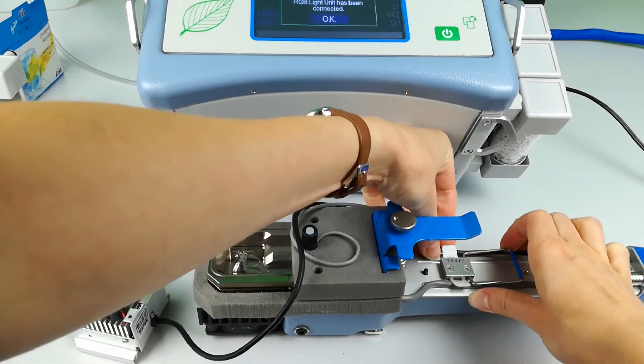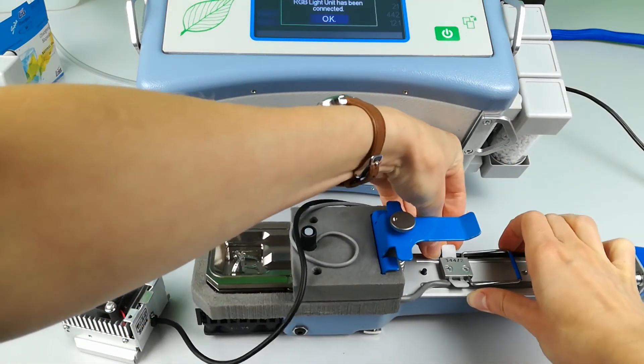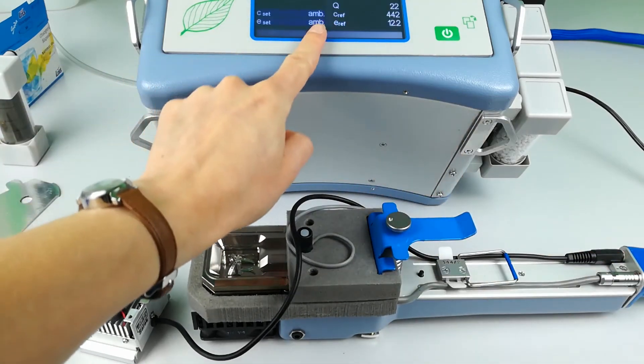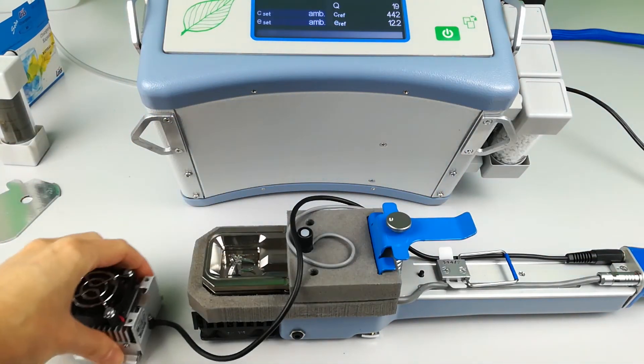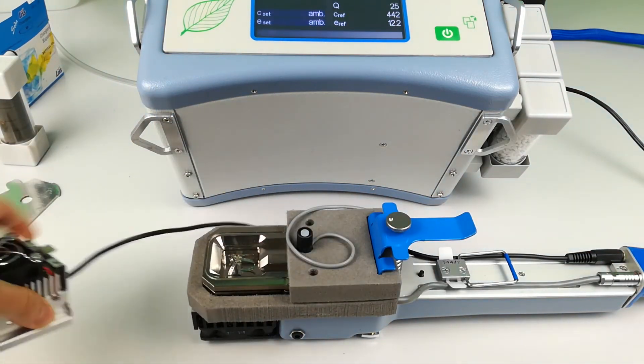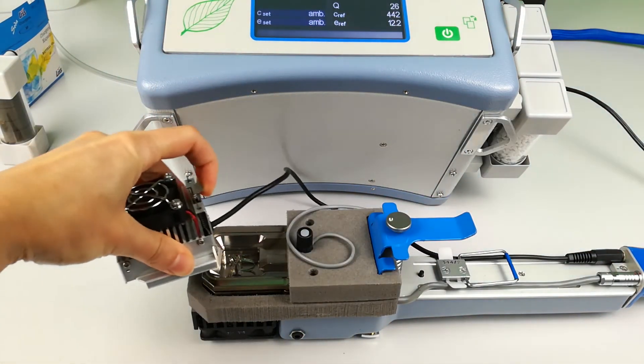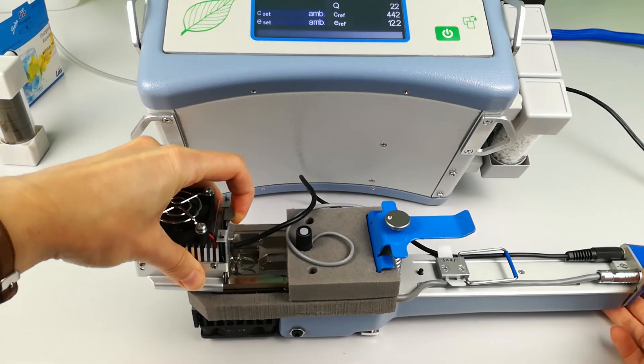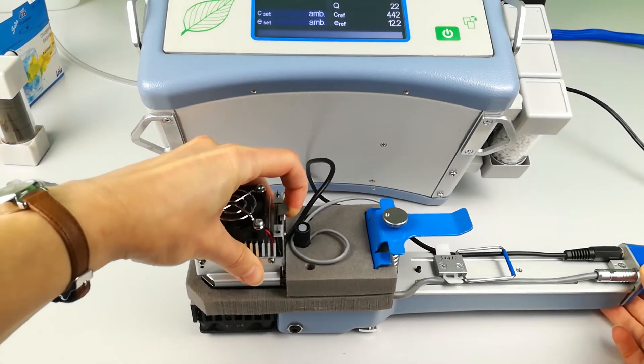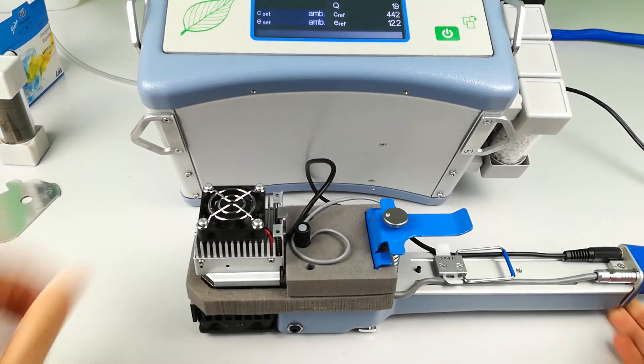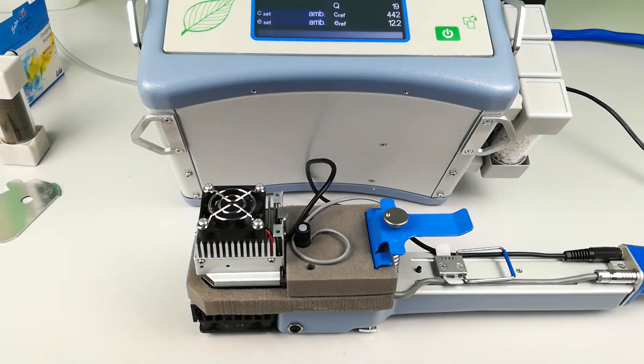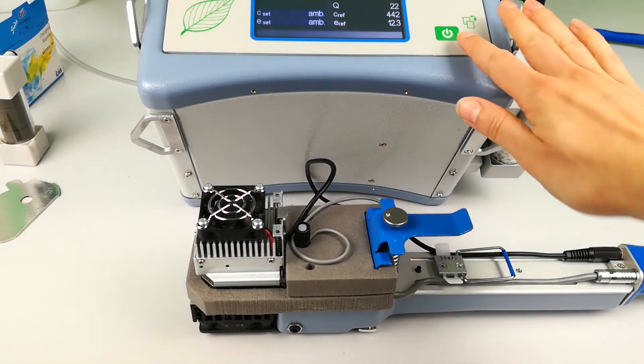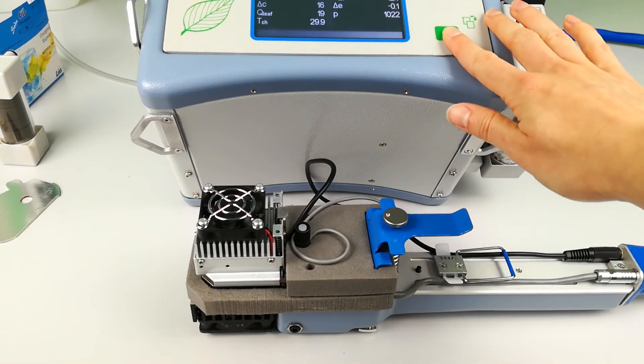Use the plastic clip to secure the cable. Lift up the metal tab at the back of the light unit. Slide into the grooves on the upper jaw and release the clip once the light unit is securely in place.